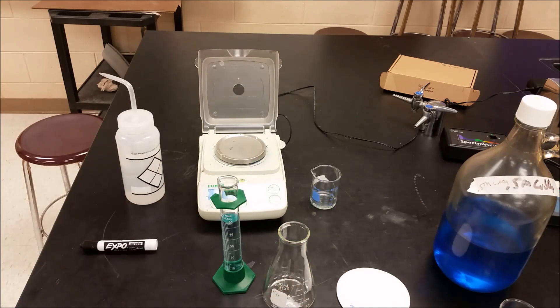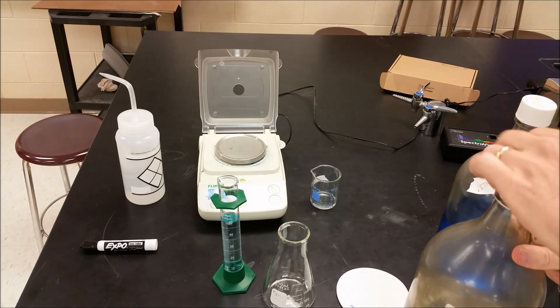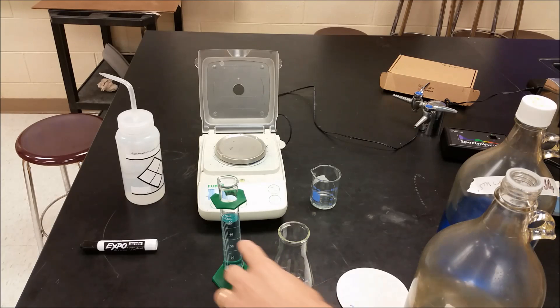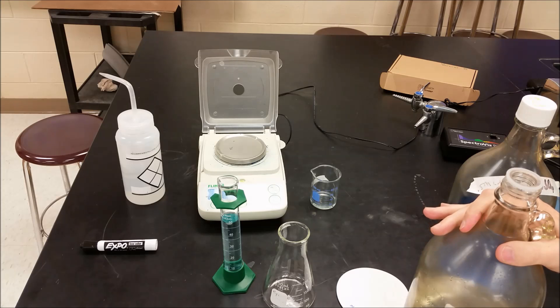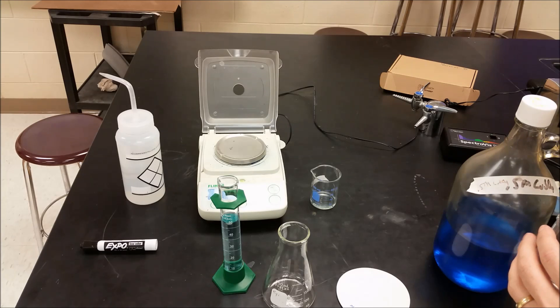So what I want to do with that is I'm going to mix that with some barium nitrate. Now the barium nitrate is 0.2 molar. And one of the conditions of this experiment is that the copper(II) sulfate cannot be greater than 0.08 molar. So I really don't need as much barium nitrate as I do the copper sulfate unknown concentration. So I'm going to get about 20 milliliters here.